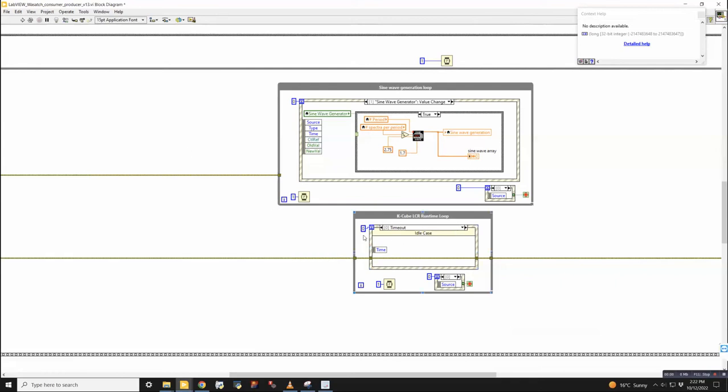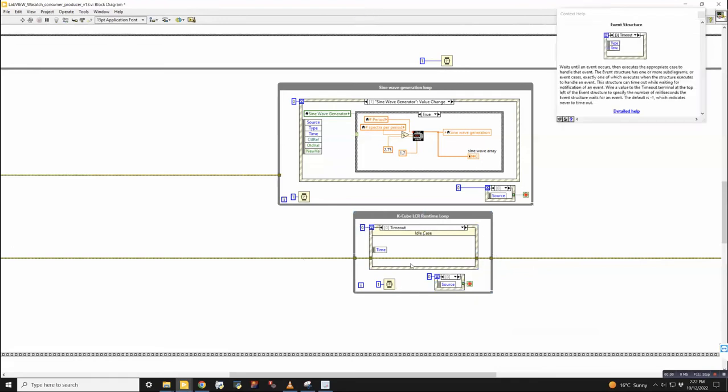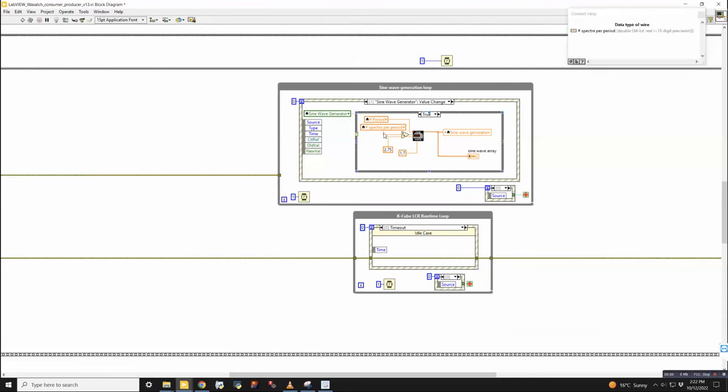So definitely remember to do that. That's been the source of a lot of problems for me, where a while loop will get stuck waiting over here and it will affect other loops that are happening in the software. So what you want to do is ensure that all these loops are running at the same time in parallel. These are completely uncontrolled loops. They're all running by themselves independently, and you want to make sure that remains the case. That's the most flexible way to do the programming, I think.